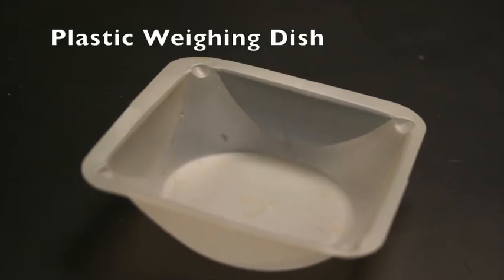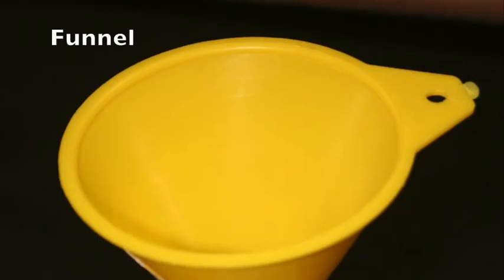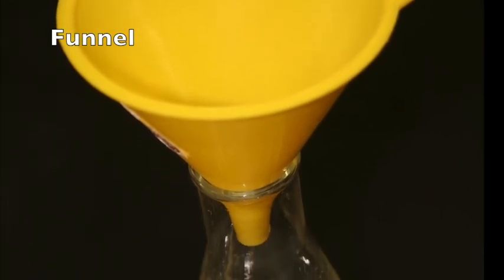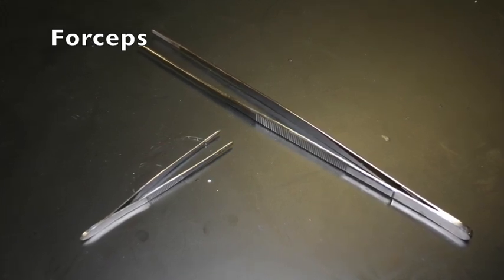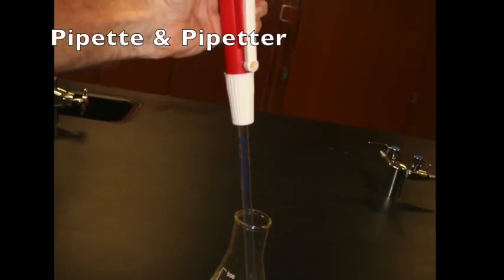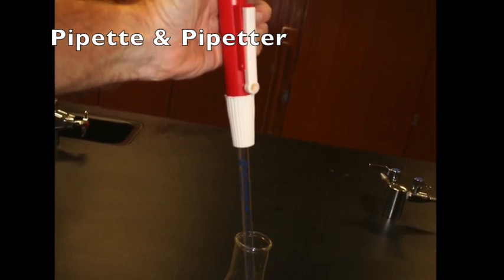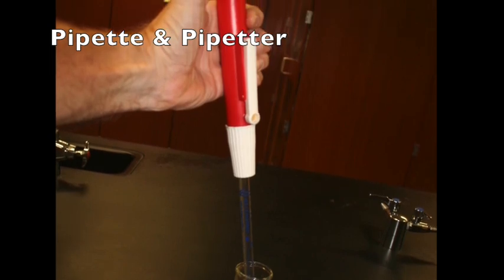A plastic weighing dish is often used to hold small amounts of substances when measuring. A funnel is a glass or plastic cone-shaped tool used to pour liquids into small opening containers such as a flask. Forceps, also known as tweezers, can be used to pick up and hold small objects. The pipette is a glass tube that can accurately measure small volumes of liquid. It is used in conjunction with a device known as a pipetter, which is designed to rapidly draw and release the liquid in the pipette.